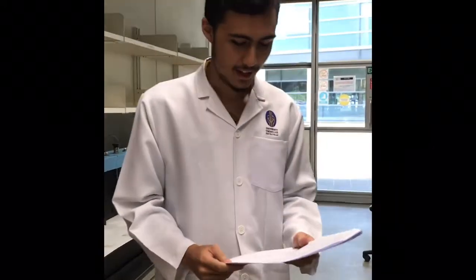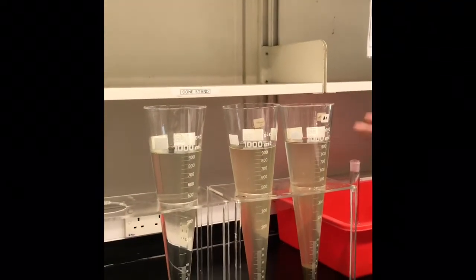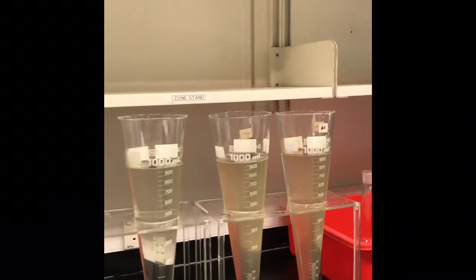For part A of this experiment, we put the 3 samples into Imhof cones. We put 1 litre of each sample and then we wait for 1 hour for the sedimentation to take place. After 1 hour, we record the volume of sediment.